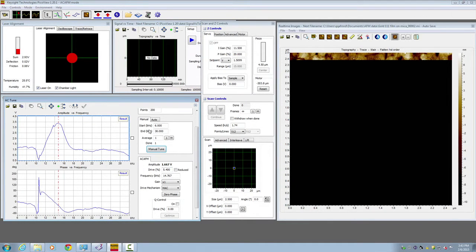In the tuning window, we want to switch the drive mechanism on AC AFM from AC to either top MAC or MAC. When this choice is on the MAC mode, imaging is going to be driven by the MAC sample plate. When we choose the top MAC, the MAC signal will be driven from the solenoid in the nose cone. Now let's adjust to the MAC, so we drive the MAC imaging using the sample plate.